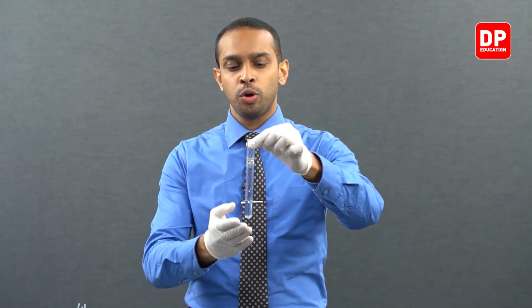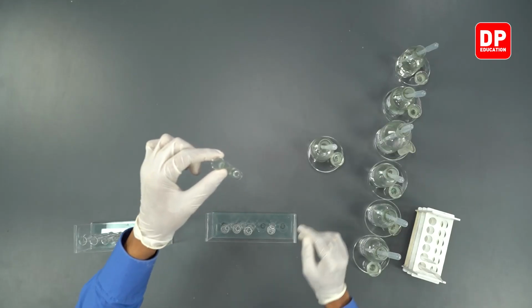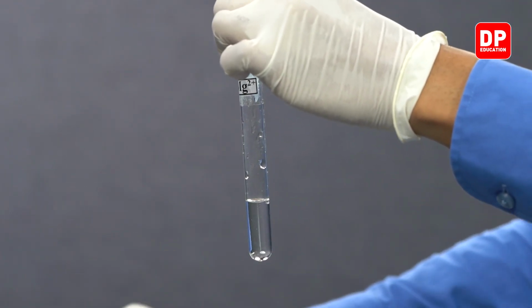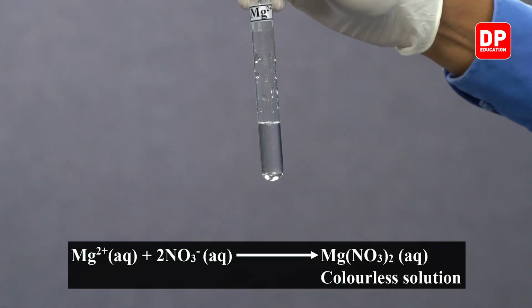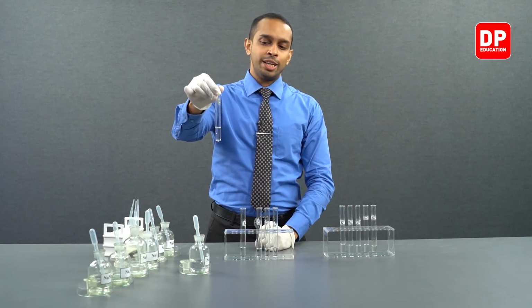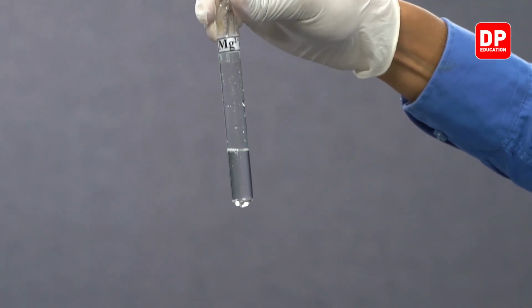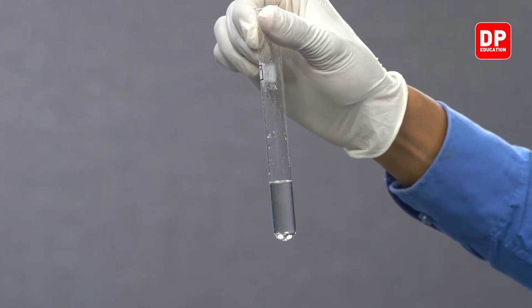Let's move on to a group 2 element, magnesium 2 plus aqueous ion solution. To that, let's add a small amount of sodium nitrate. We added a small amount of sodium nitrate into magnesium 2 plus aqueous ion solution. As you can see, upon addition of nitrate ions into magnesium 2 plus solution, we do not see the formation of a precipitate. We form magnesium nitrate here, and we do not observe a precipitate being formed upon the addition of nitrate ions.